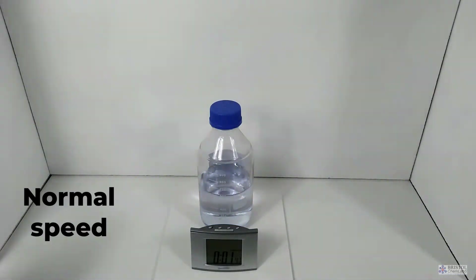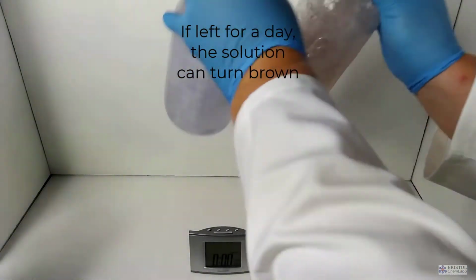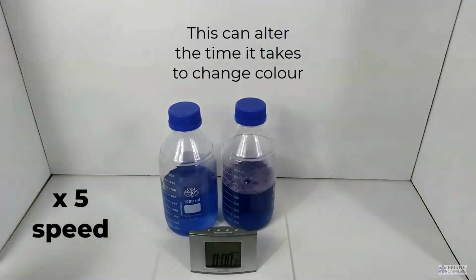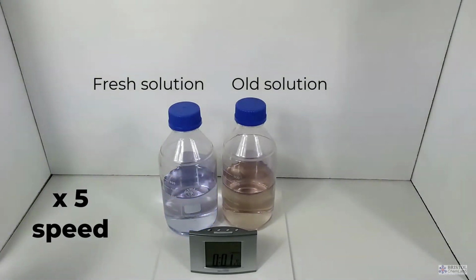They might come up with all sorts of answers, from the heat of your hand causing the color, the sound energy from your voice is causing the change, and those which are a little more dubious might suggest that you've secreted some form of chemical in the cap of the bottle, and this is in fact a magic trick. Please dispel the idea that chemistry is magic. Have fun with this experiment.